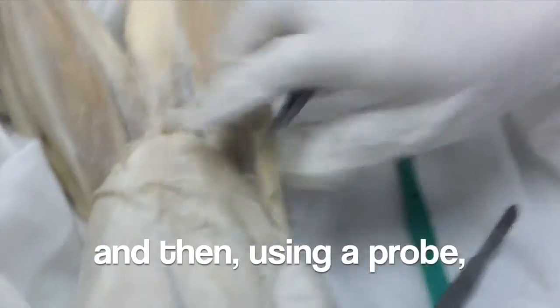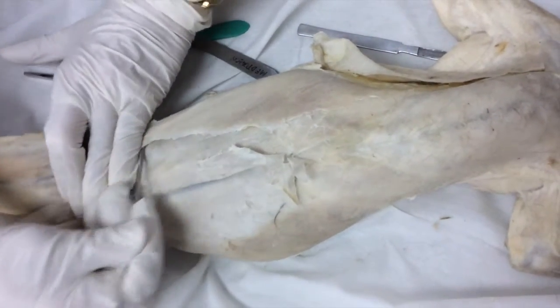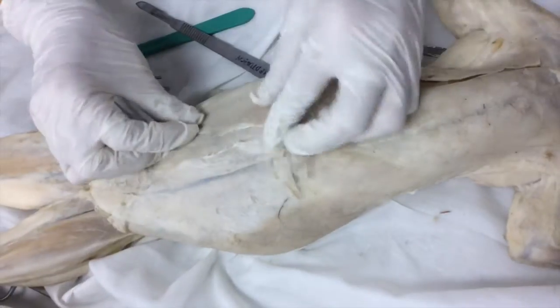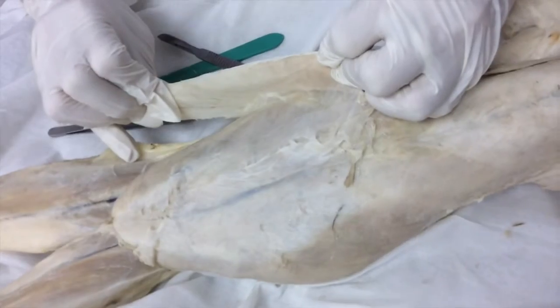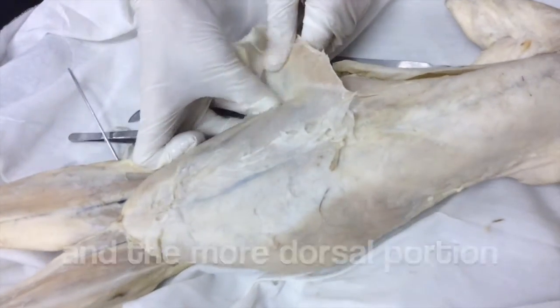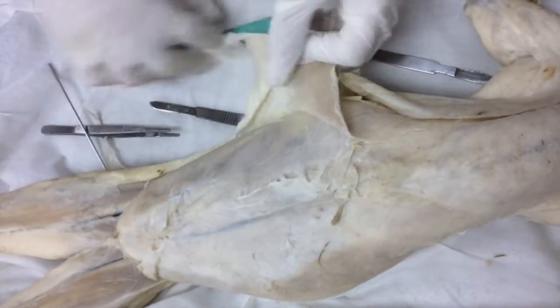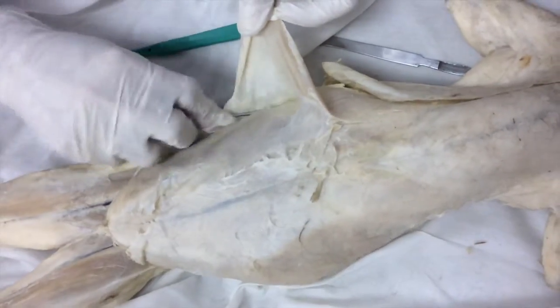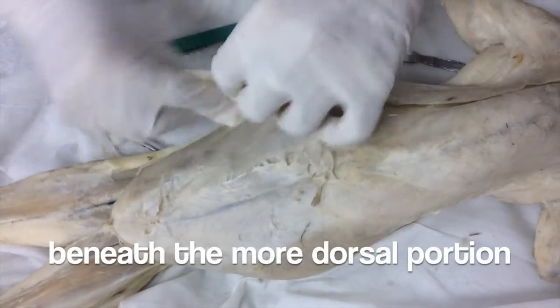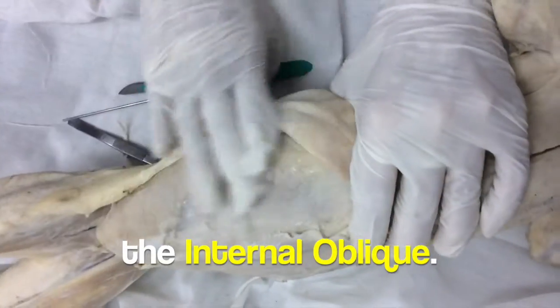This is the fascia. Using a probe, then use the finger. This is the external oblique — the more dorsal portion of the external oblique. Beneath the more dorsal portion of the external oblique, you'll find the internal oblique.